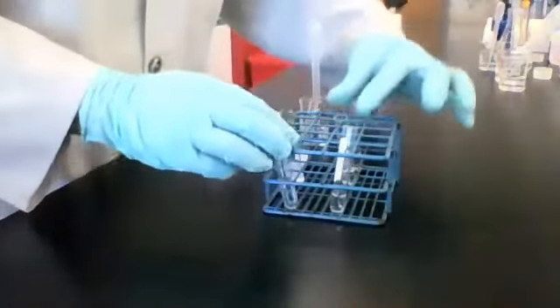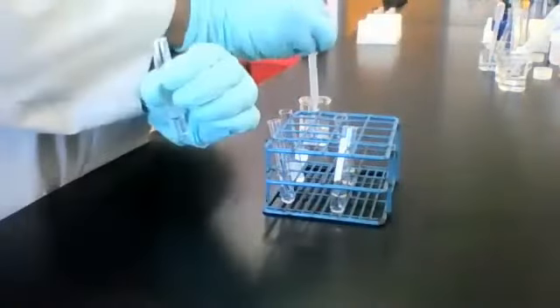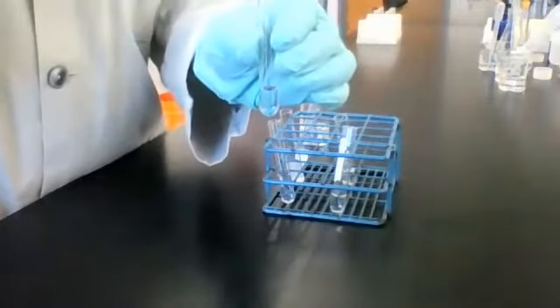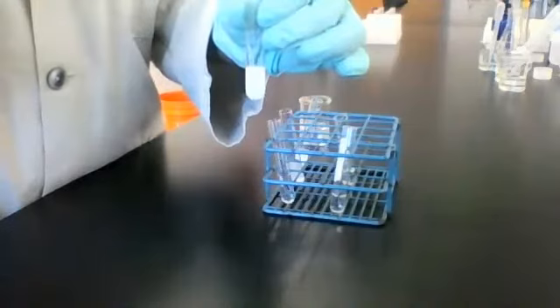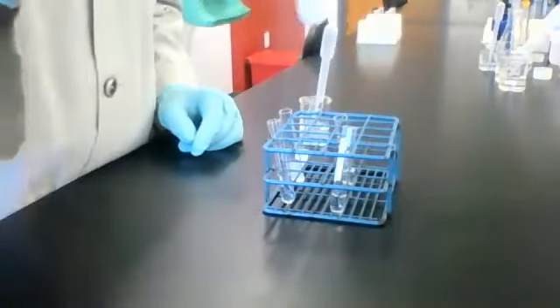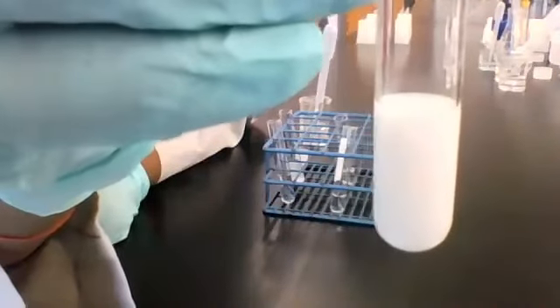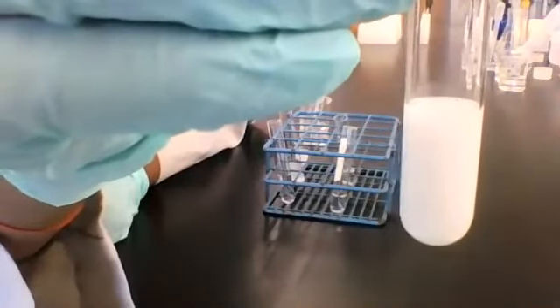All right. Moving on, solution 4, which is ammonium chloride. Let's add reagent C to see what happens. All right, here it is. Here's the resulting mixture between solution 4 and reagent C.